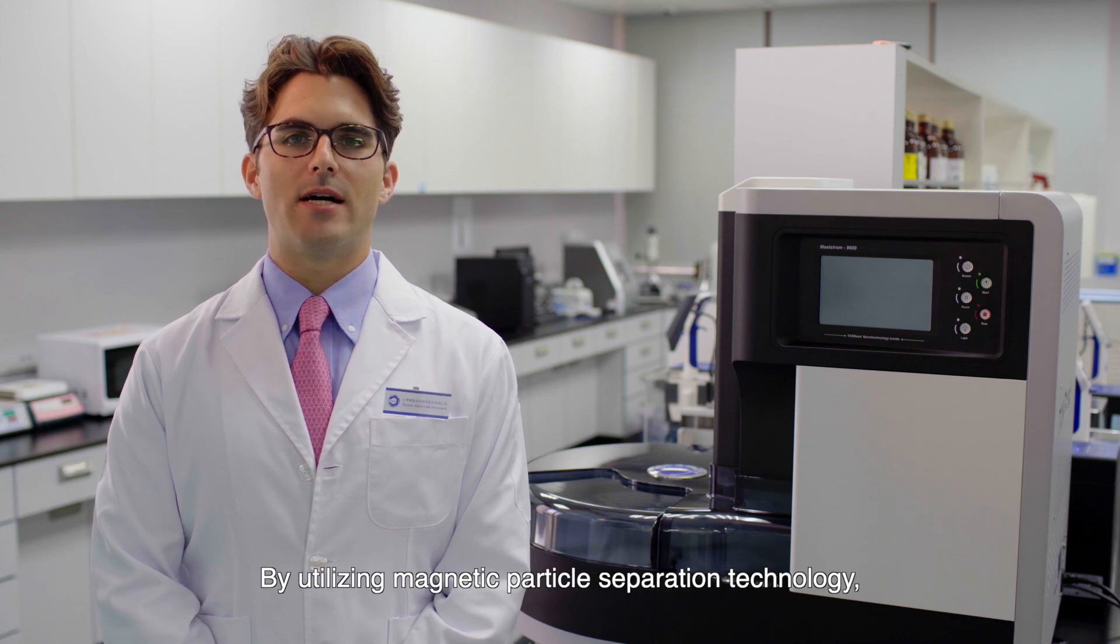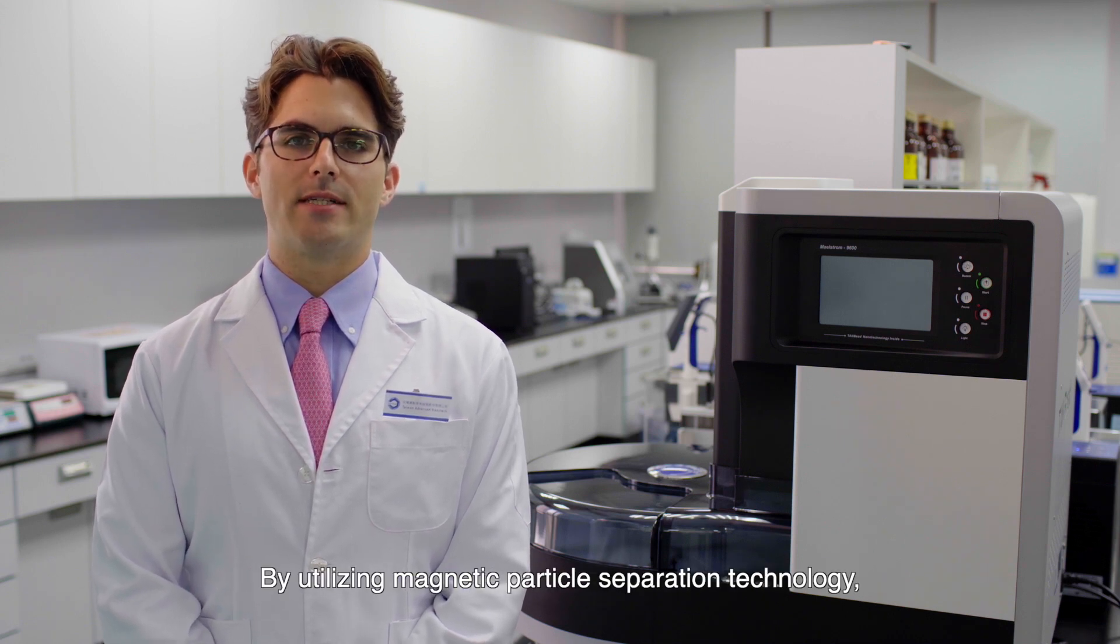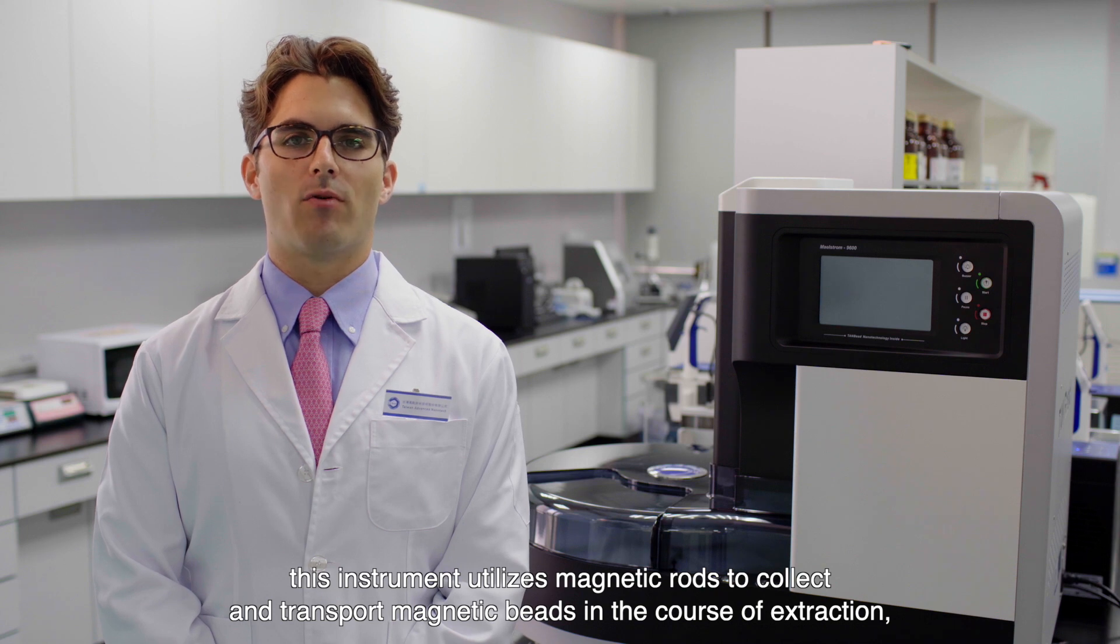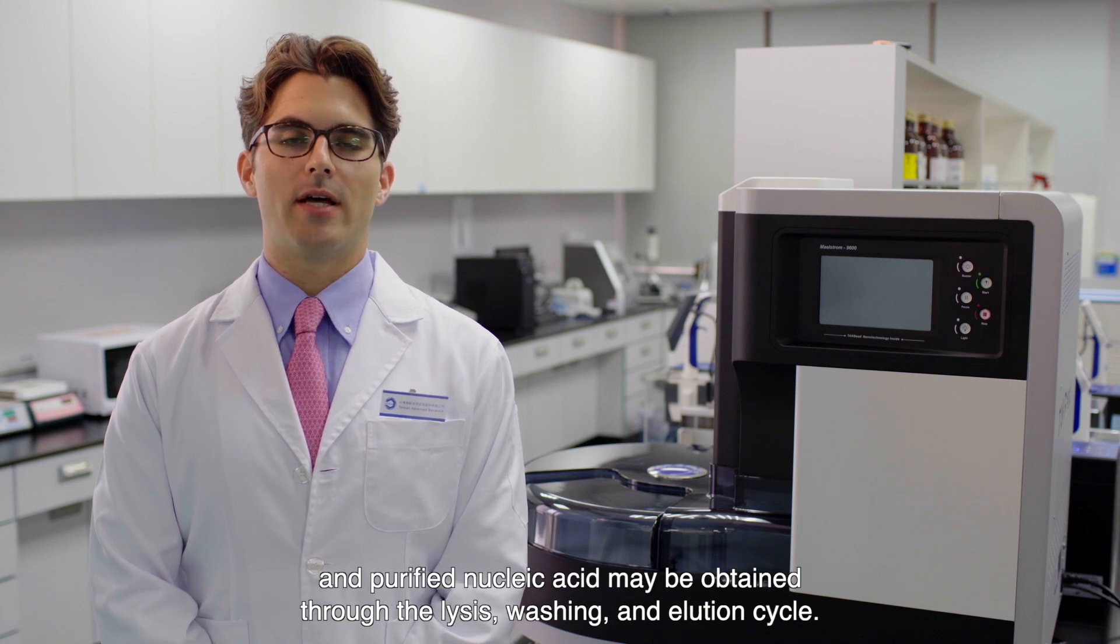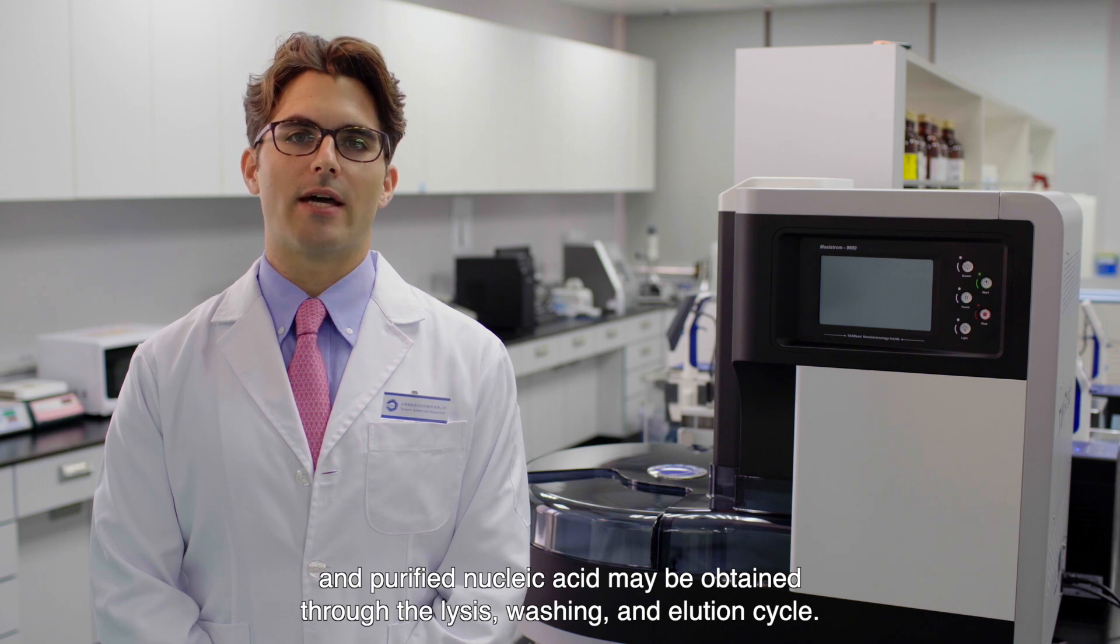By utilizing magnetic particle separation technology, this instrument utilizes magnetic rods to collect and transport magnetic beads in the course of extraction. Purified nucleic acid may be obtained through the lysis, washing and elution cycle.